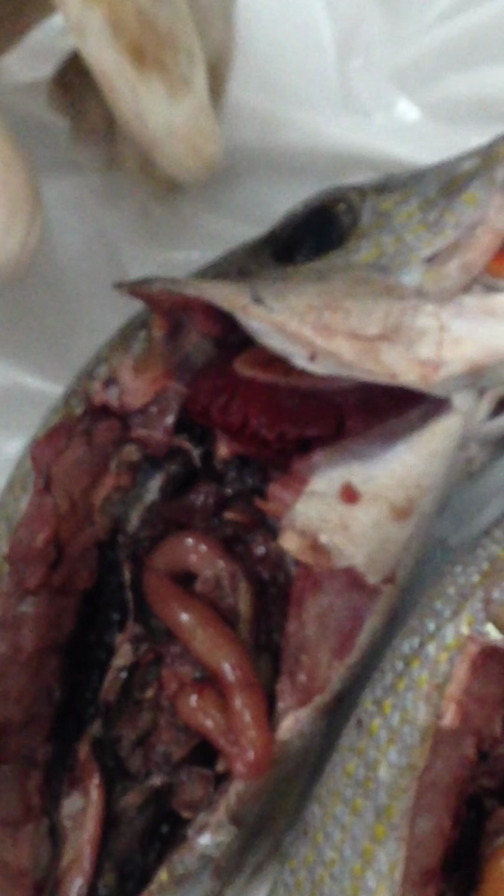And now look at this structure right here. It looks like it is something associated with the gills, but that structure determines the oxygen concentration in the blood, and it is called the pseudobranch. It determines how much oxygen is still present in the blood, and then the fish decides whether to continue gaseous exchange in the gills or to stop it.